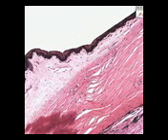And the sclera is also fibrous tissue, but it is not really as transparent as a cornea. I heard that if you blow through it with a soda straw, so you get warm air on it, it'll become quite a bit more transparent. Everything that's pigmented in here is now part of the middle tunic of the eye, called the vascular tunic.